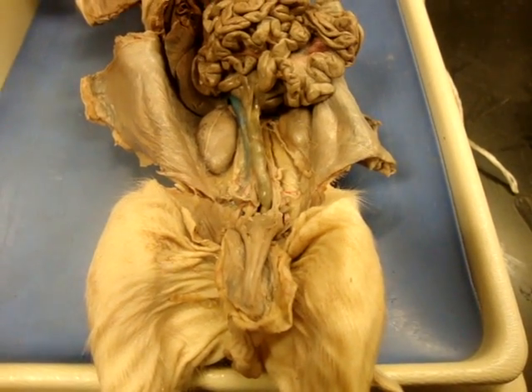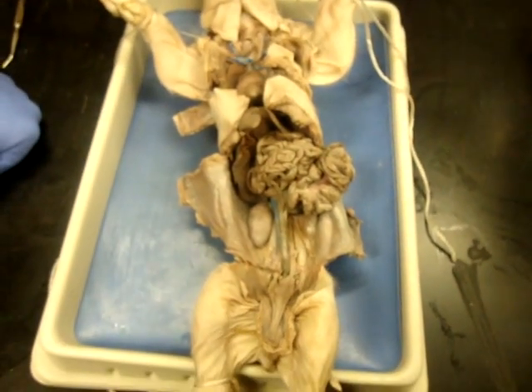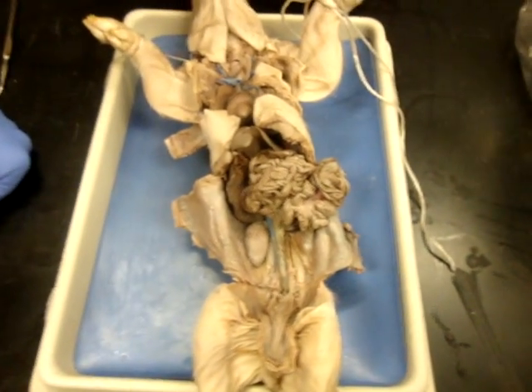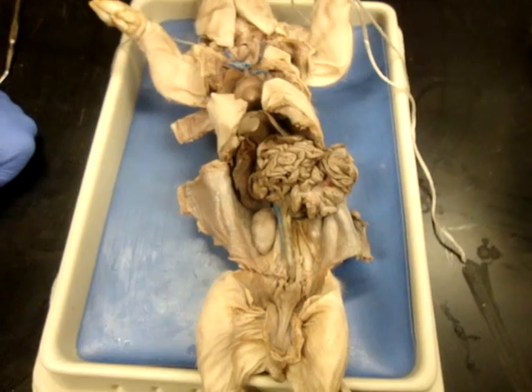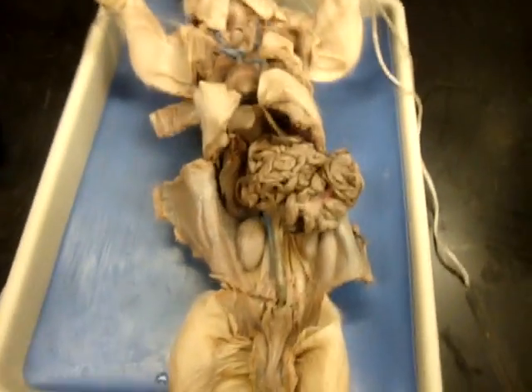So that covers all of our external, oral cavity, neck region, thorax, and abdomen. We still have veins and arteries to go through. Your best way to do this is to actually couple them up.